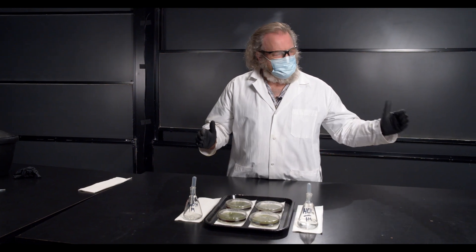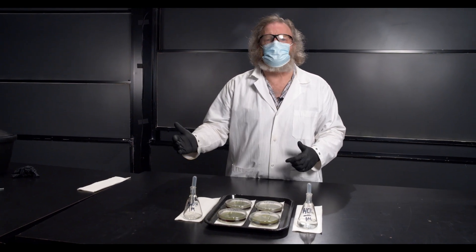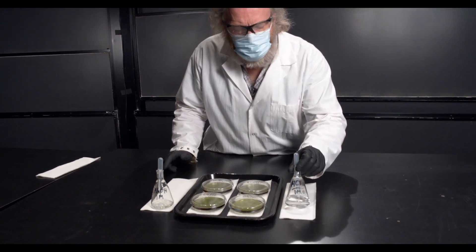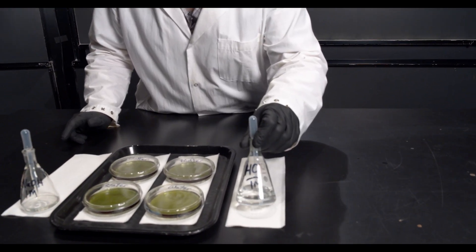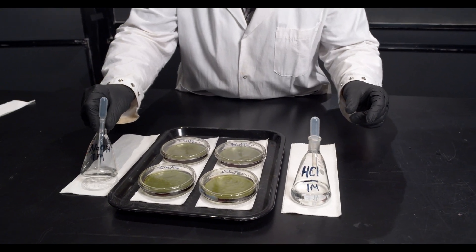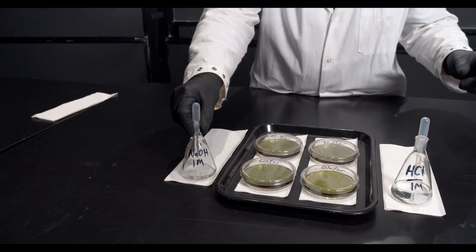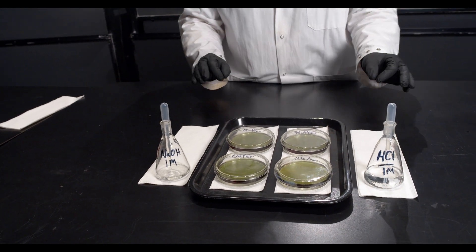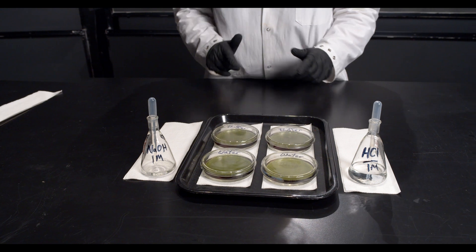I've got hydrochloric acid one molar with a dropper and sodium hydroxide one molar with a dropper so that we can add just a tiny amount of acid or base to see how it changes the pH.